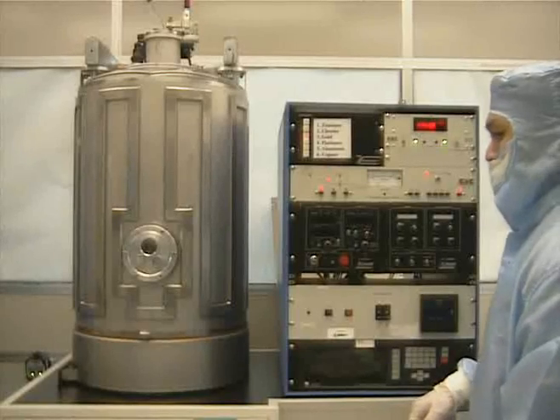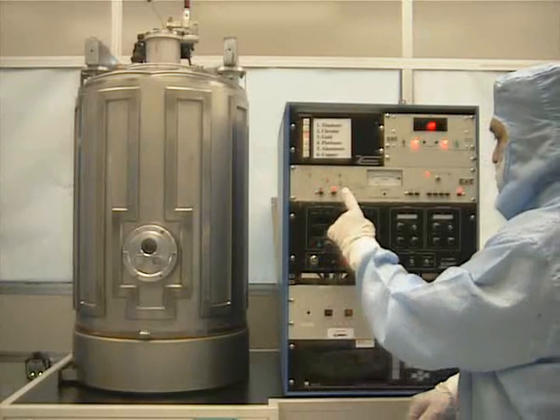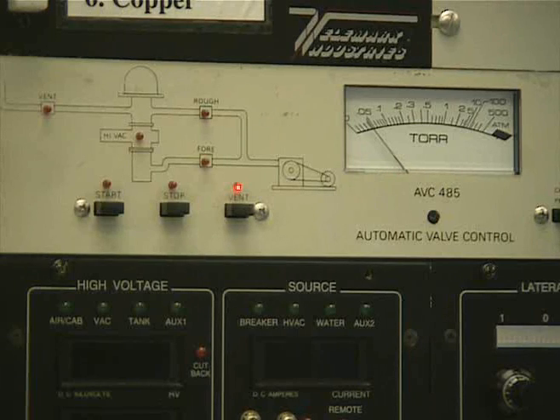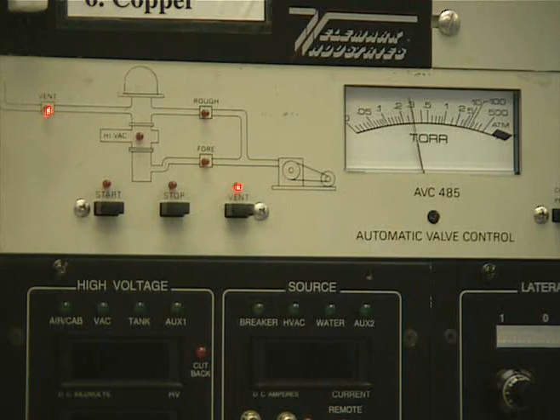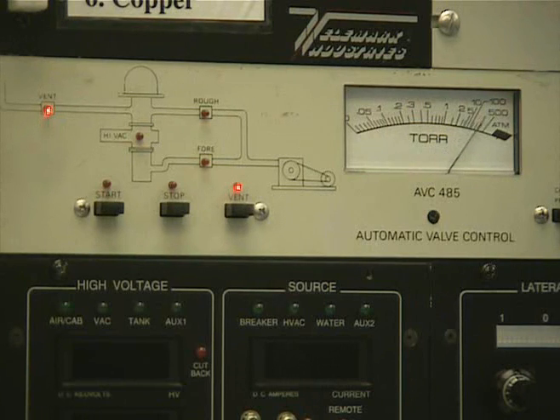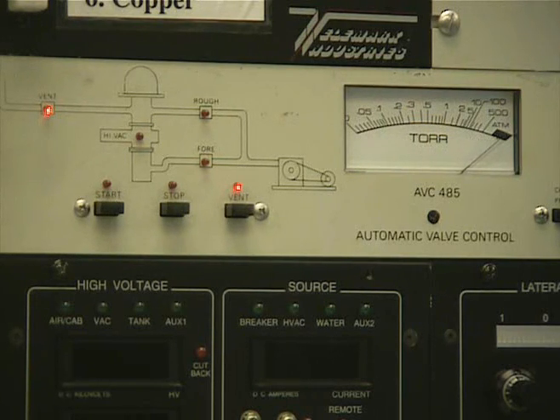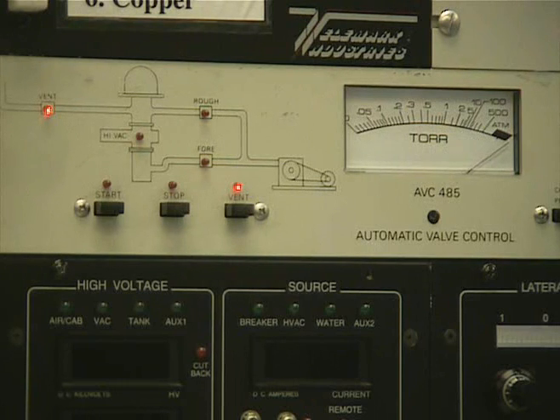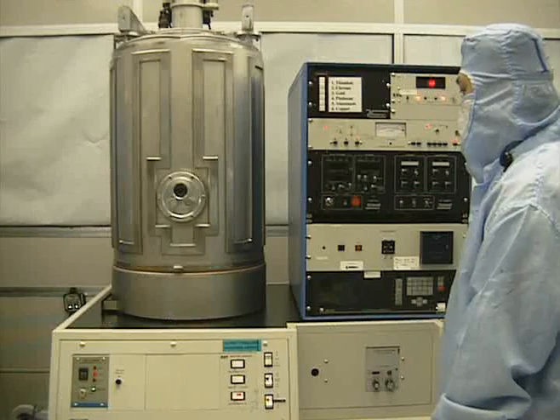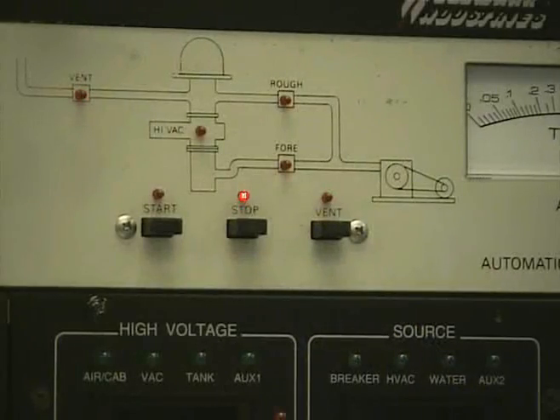We first want to go to the automatic valve controller and press the stop button, and then the vent button. We will then wait a few minutes for the system to vent. Wait until the needle on the chamber pressure gauge reaches the right side of the display. We can tell the chamber is vented by either waiting for a clicking noise, a hissing noise, or by actually feeling the nitrogen gas coming out of the chamber by the seal. Once you hear the clicking noise, push the stop button to close the vent.